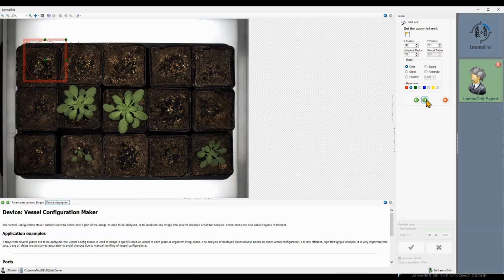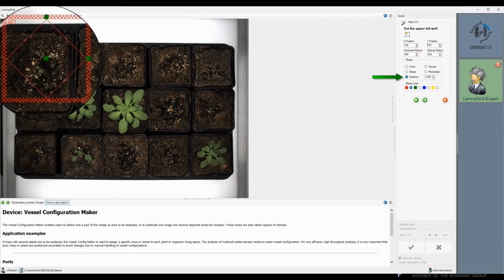At this point, we also define the shape and size of all regions of interest. For the shape, we have these options: circle, ellipse, square, rectangle, and freeform. Freeform is the interpolation between the other shapes driven by a parameter. A parameter value of 1 represents a diamond shape. A parameter value of 2 is a circle or an ellipse.